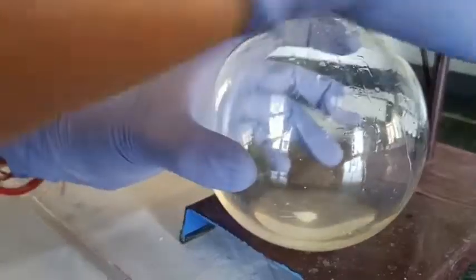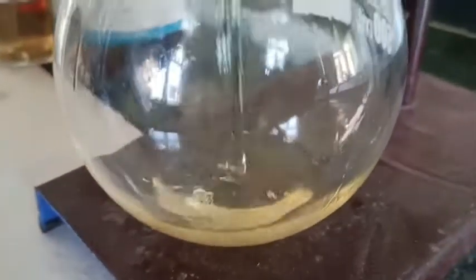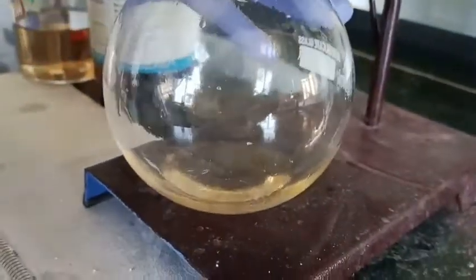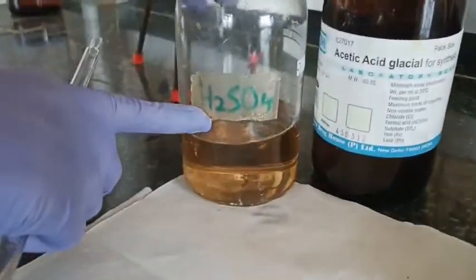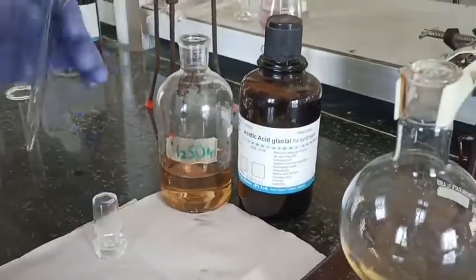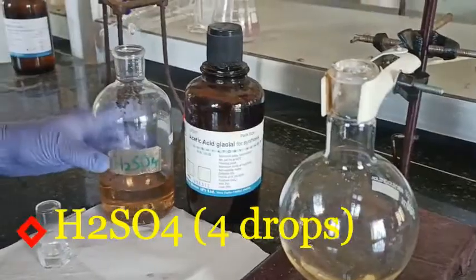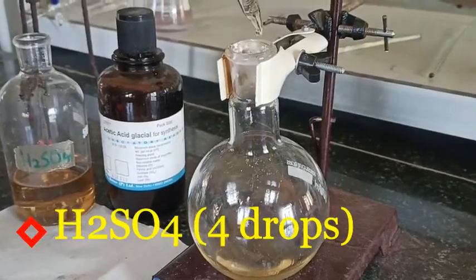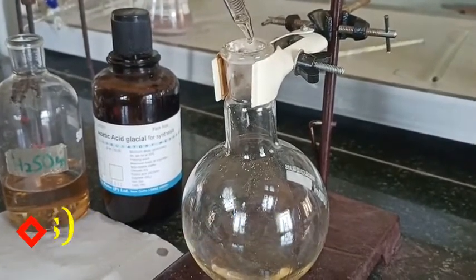With the help of a glass rod I will try to dissolve it again. In this way, by using the glass rod I have dissolved all the salicylic acid into the acetic acid. Now to this we are going to add 4 drops of sulfuric acid. So 4 drops of sulfuric acid have been added to this mixture of salicylic acid and acetic acid.